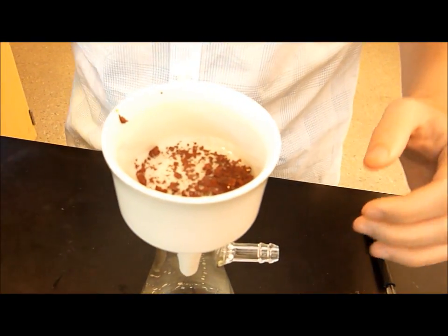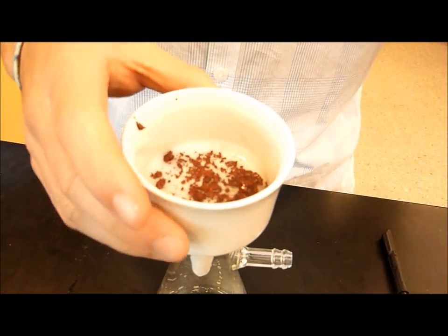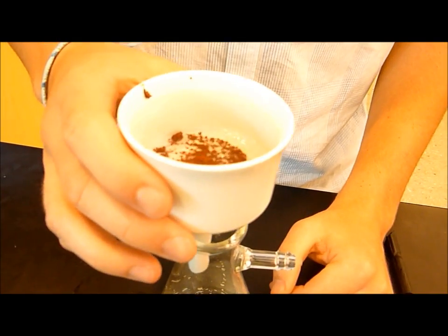Alright, so you just kind of want to swish it around a bit to get all the water out. Because you want, on the top, you just want it to be the copper. You don't want any water. And we'll see you in a minute.